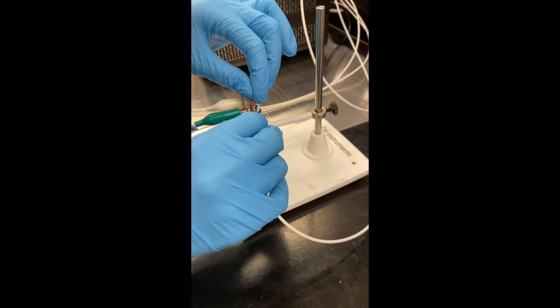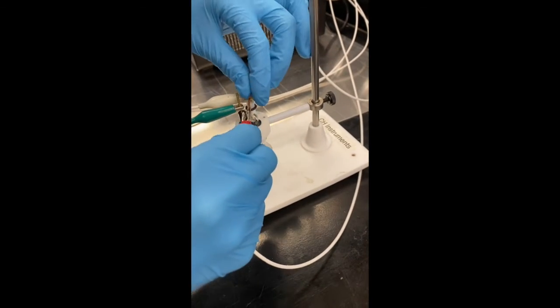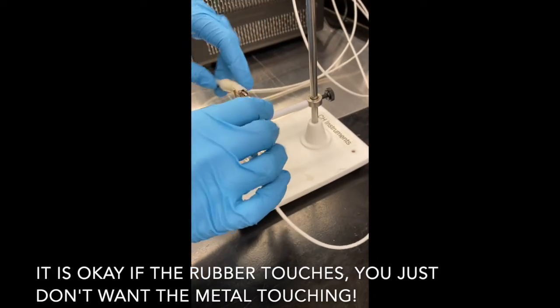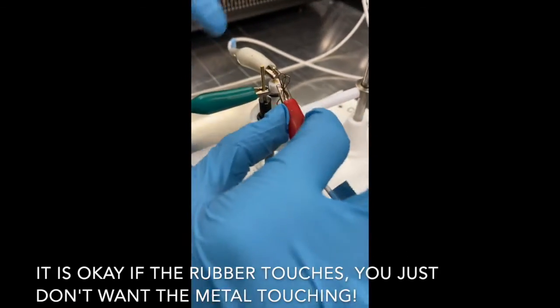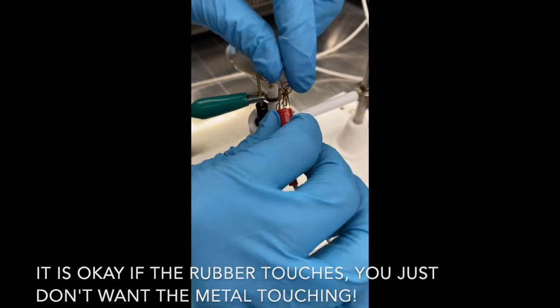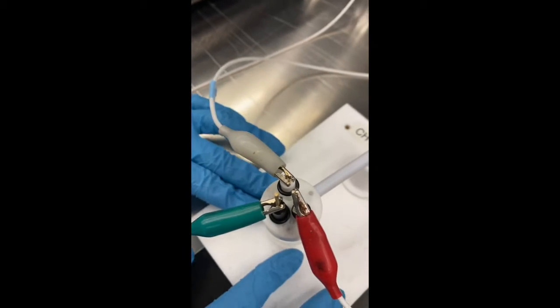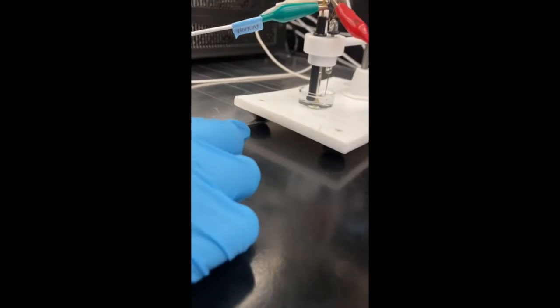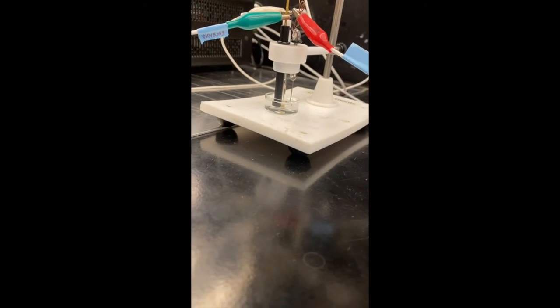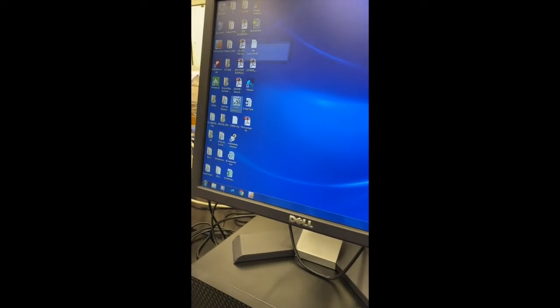And it's really important here that the electrode connectors don't touch each other. So you might have to do some rearranging. I'm going to kind of pull this over there. Good. So there's no touching between them. And then I'm going to clarify once again that all ends are submerged. There's no contact between them. This all looks good. So now we're going to come over to the computer and open this app right here, CH Instruments.